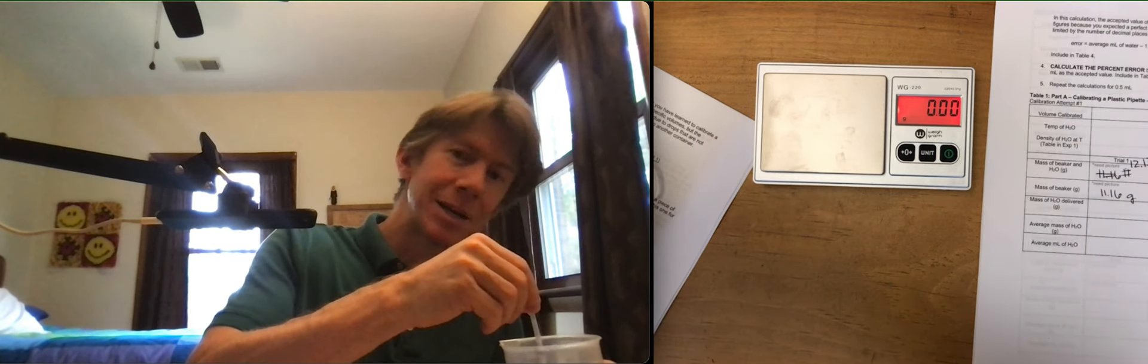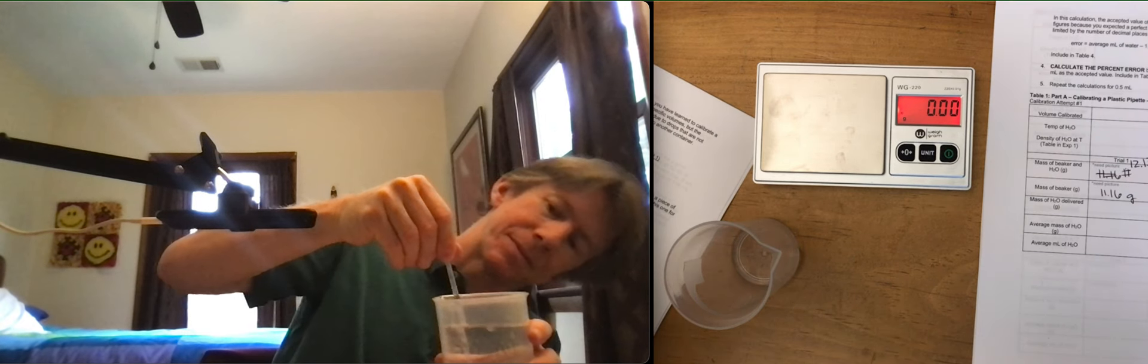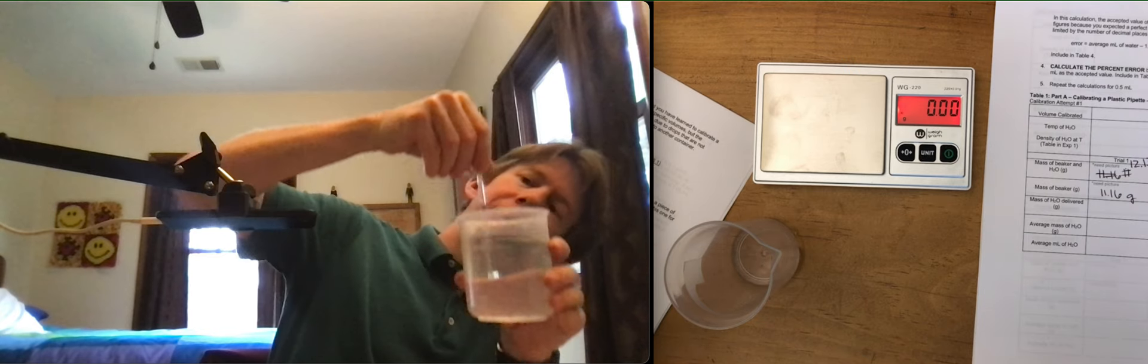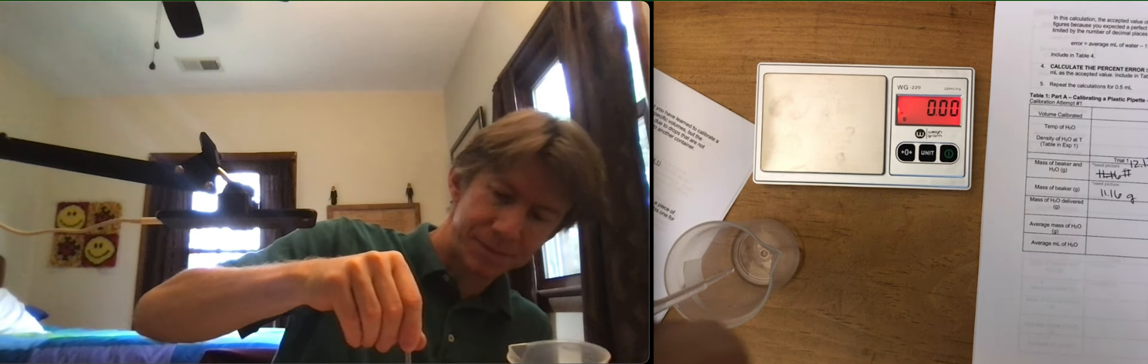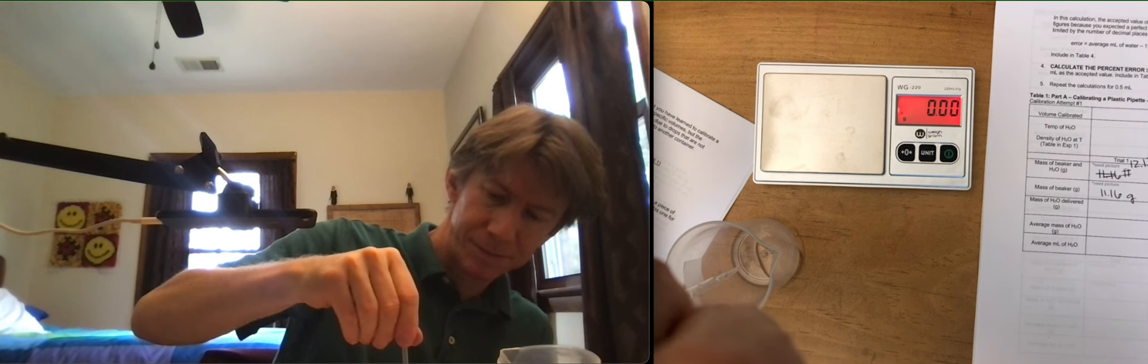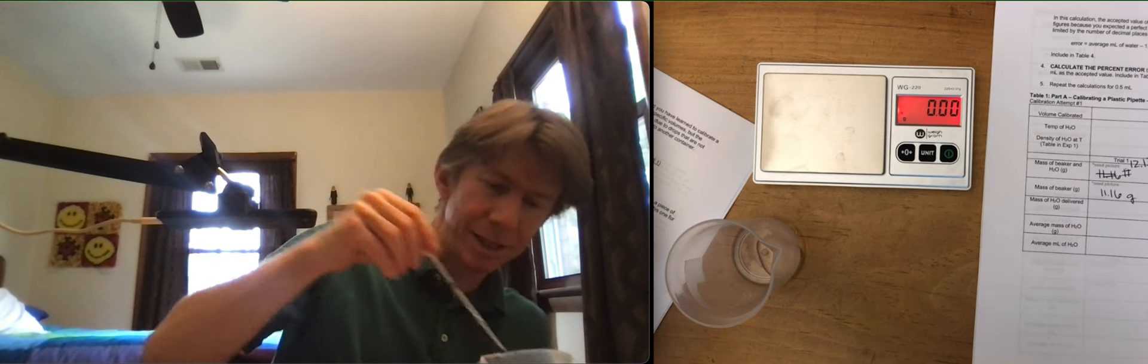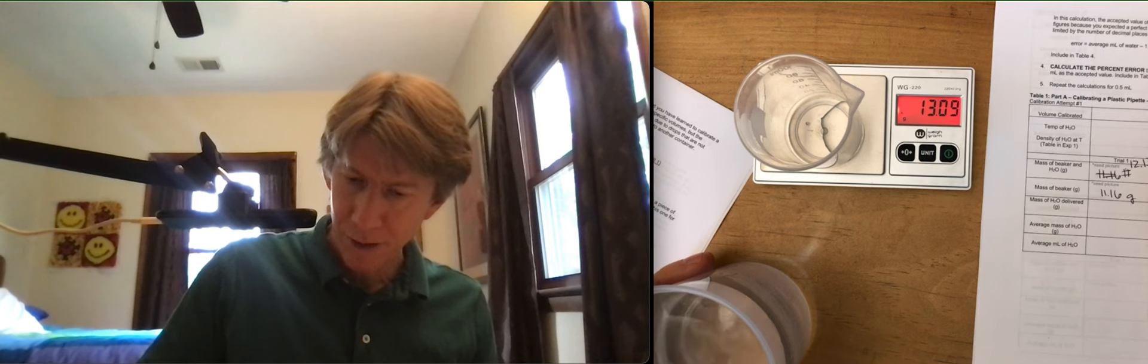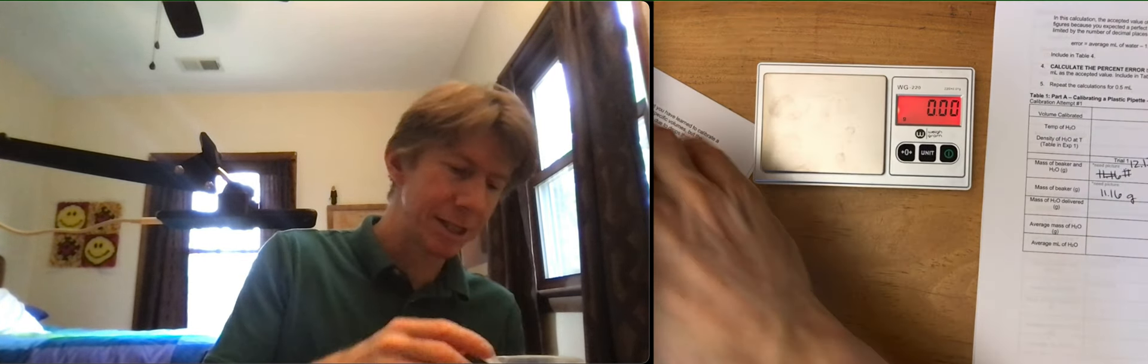Let's do it again. This time, I am taking it off, which is what I'm supposed to do. I'm looking straight. Oh, bubble. There we go. I'm looking straight across. Good. Get everything out there. 13.09 grams. And one more time. See if it turns off on me.